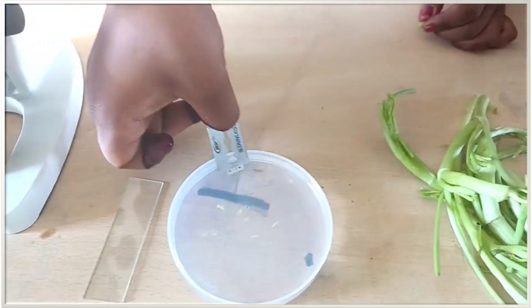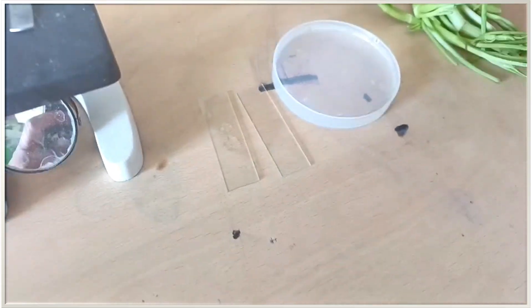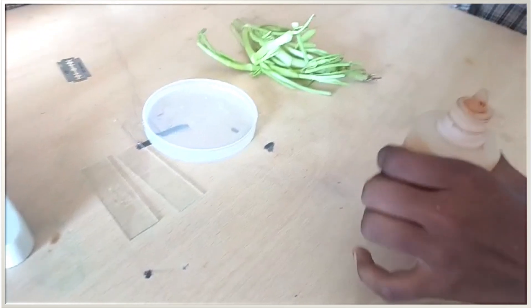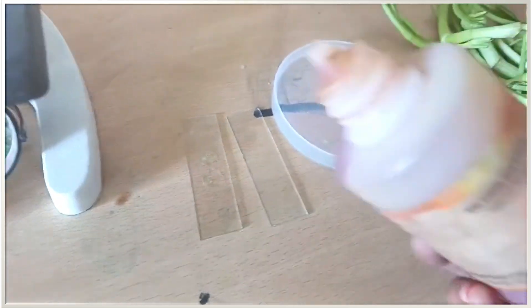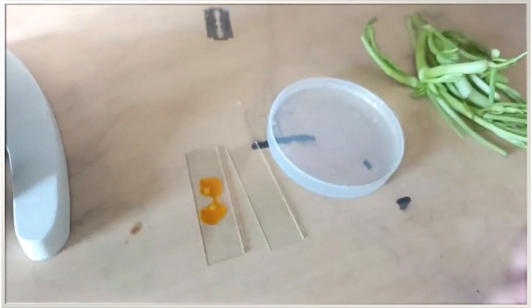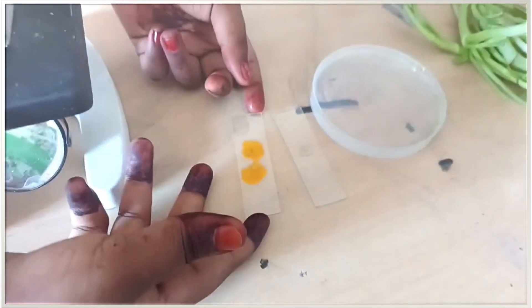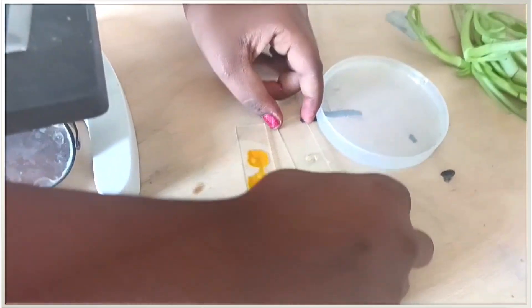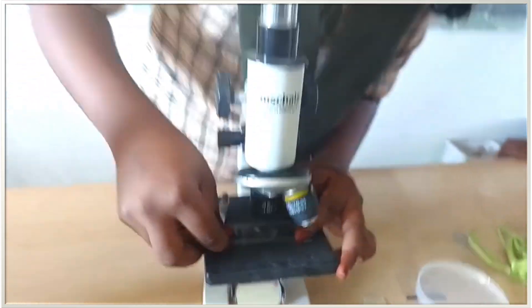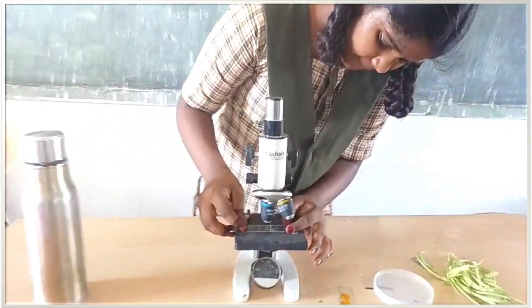She put all the sections in water, then transferred the sections onto the slide. To one of the slides she added methyl orange stain. She kept the slide under the microscope and observed the different types of tissues present in the section of the stem.